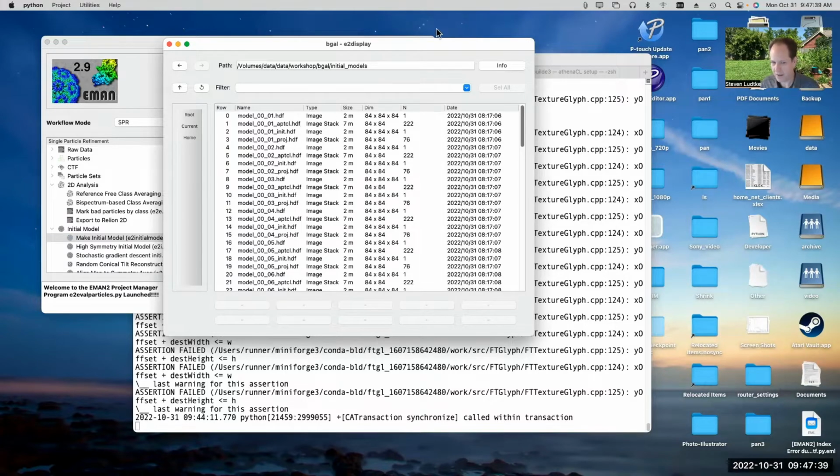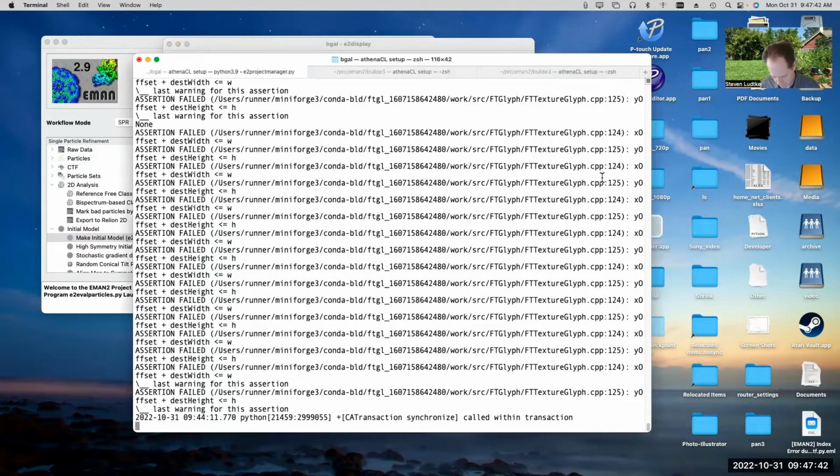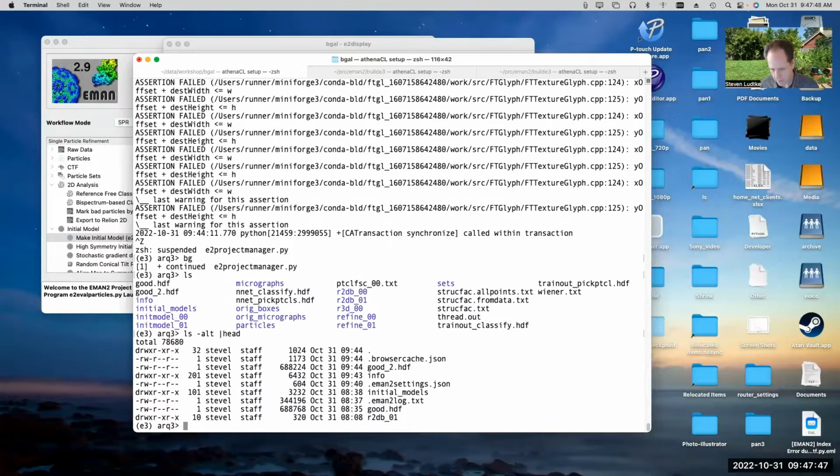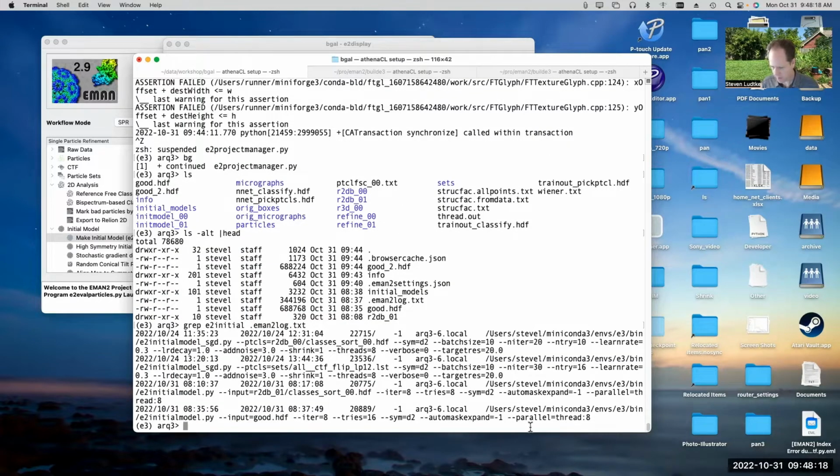If you're interested in seeing how long a program took to run, there is a hidden file called .eman2log.txt, which has a log of all of the EMAN2 programs that you ran in the current folder, other than things like e2display. Anything that generates output will produce an entry in this EMAN2 log file. So we can do something like grep e2initialmodel in the EMAN2 log, and we can see a line for each time I ran that program.